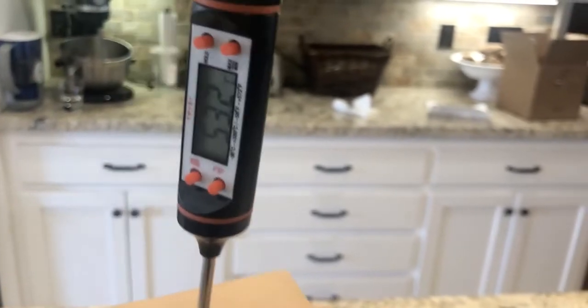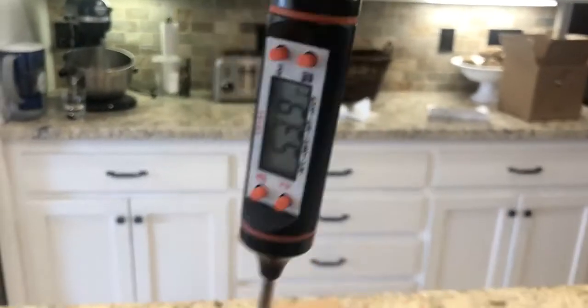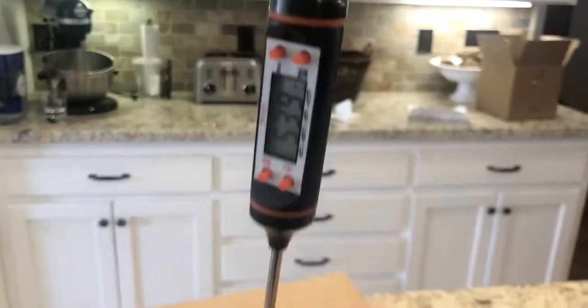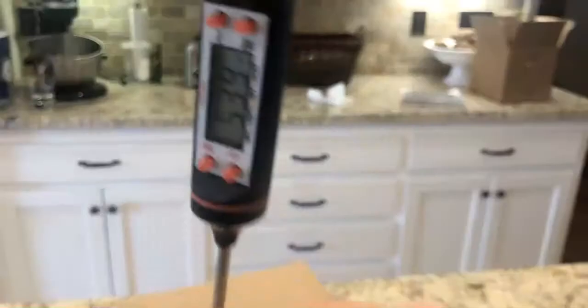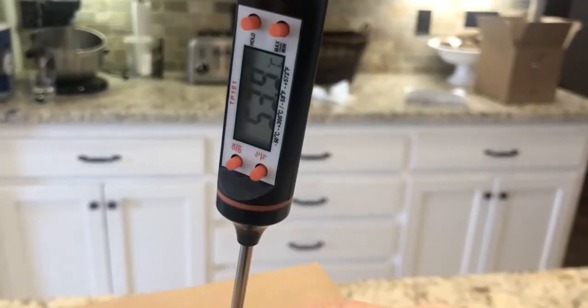The assumption we will be making is that the temperature of the boiling water bath is equal to the temperature of the water in Part 2 and the metal in Part 3. If the temperature isn't 100 degrees Celsius it's because the thermometer isn't calibrated properly. It looks like it's holding at 53.9 degrees.